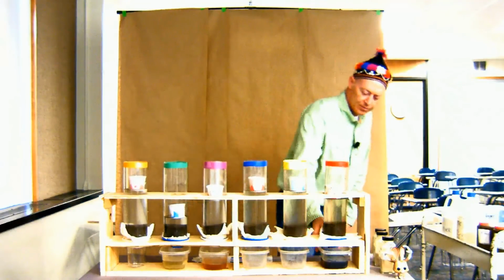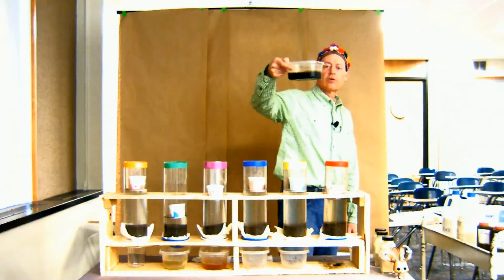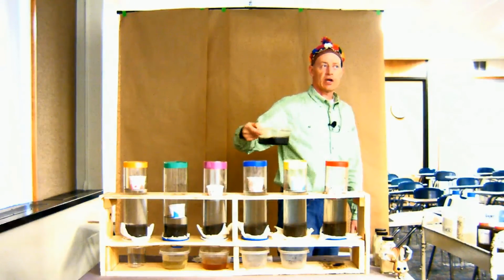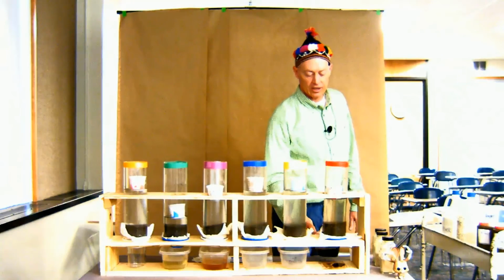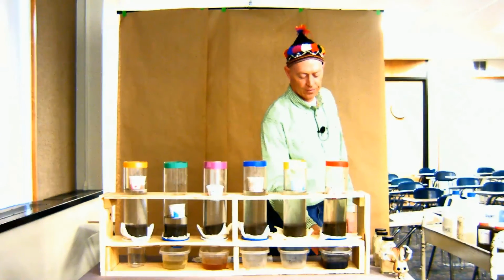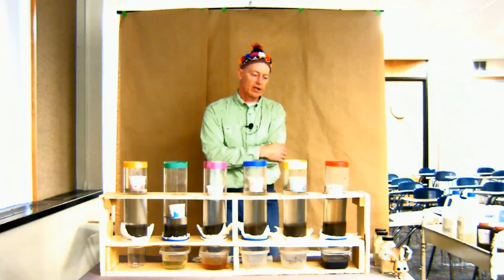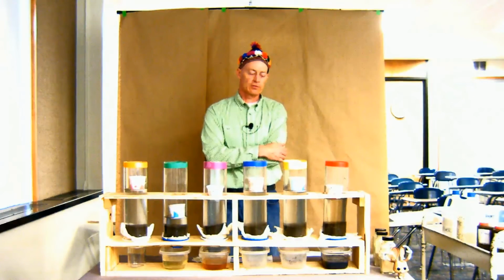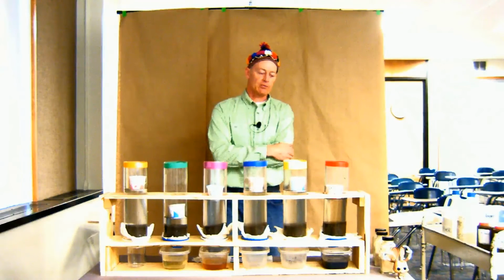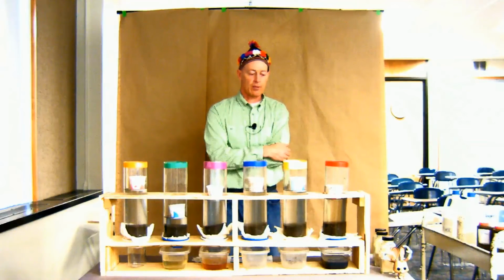But look at here. Remember how fast the first one went? What do you think all this stuff is? You can see it behind my shirt, I guess, a little bit better. That is dispersed organic matter. And so what this Sodic soil is doing is creating dispersion on the inside, in the pores, on those clay particles. The organic matter is being dispersed out, and that's the black stuff that you see coming out the bottom.